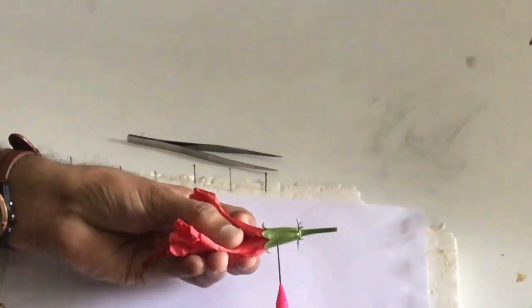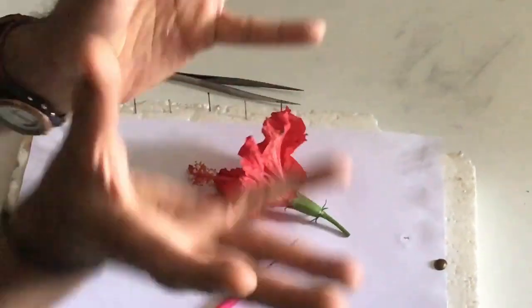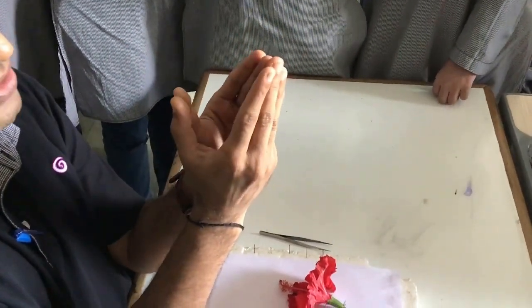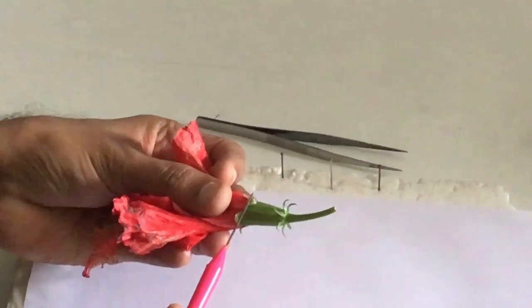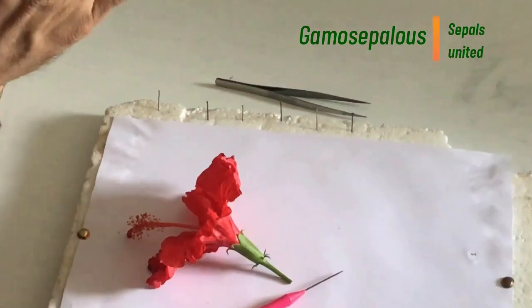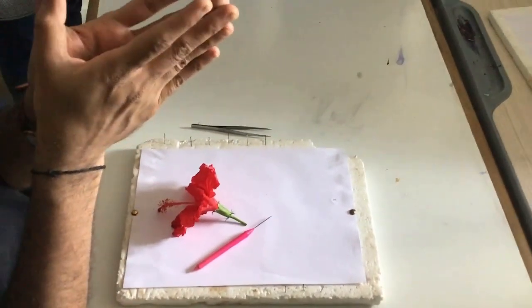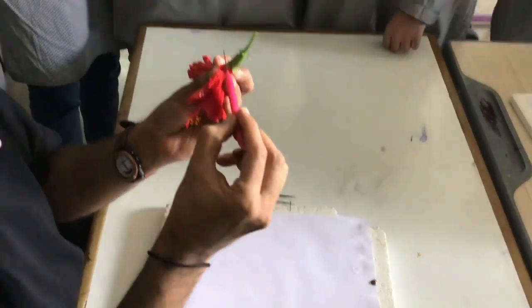This green part is the calyx. In this flower, the calyx is fused together like a jug — all units are fused together. Most of the part is fused — three-fourths is fused, one-fourth is free. When sepals are fused together we call it gamosepalous. Gamo means marriage or fusion. So this flower contains gamosepalous arrangement of sepals.